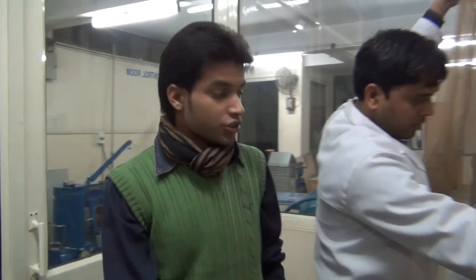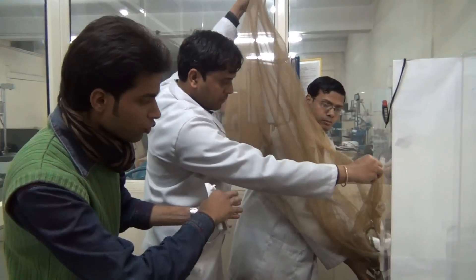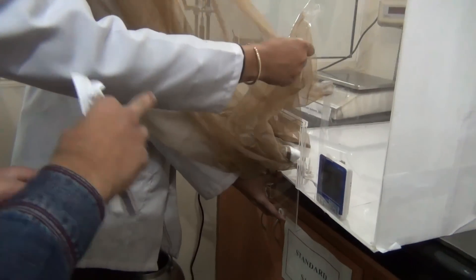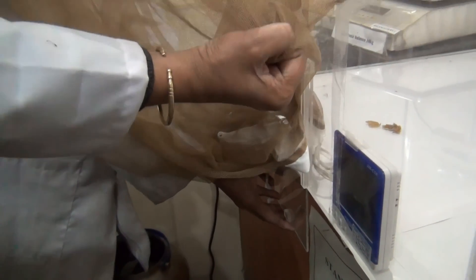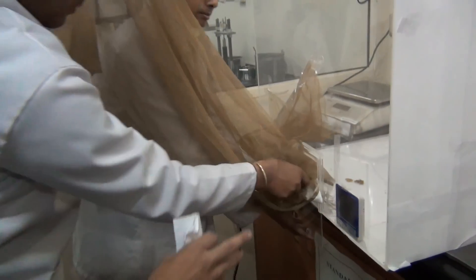As you can see, our lab assistants have come to the lab. We are going to put the mosquitoes into the glass chamber. This is a mosquito — there is a small window where the mosquito is going through. We are going to put them onto the skin surface.